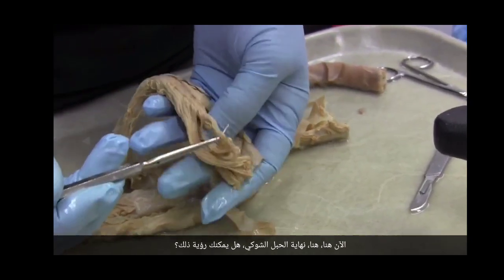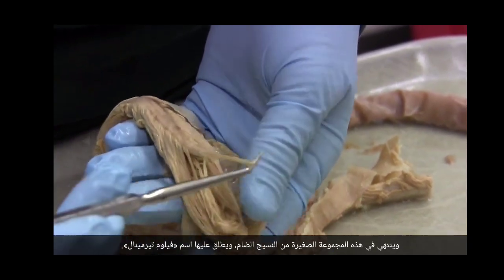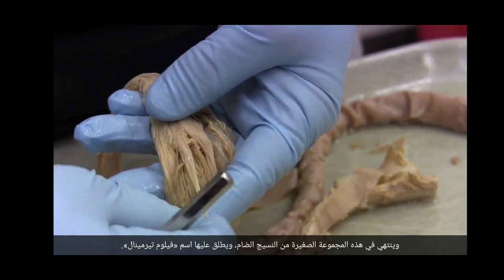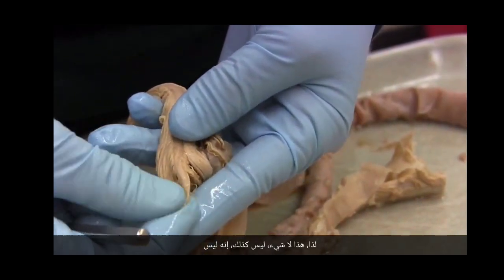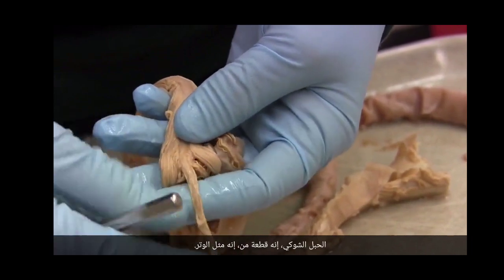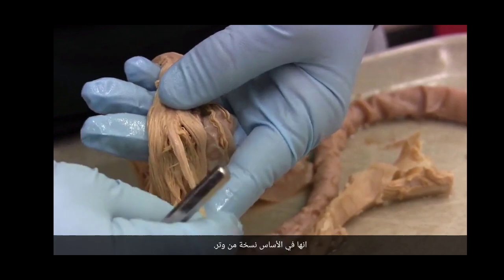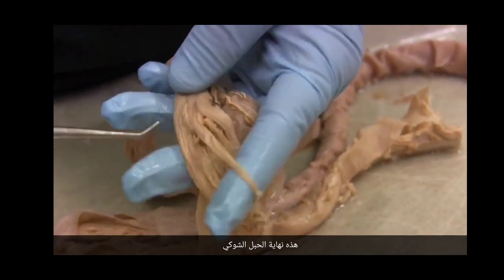Now here, right here, is the end of the spinal cord. Can you see that? That's the end. It ends in this little bunch of connective tissue. It's called the filum terminale. And so this is nothing. It's not spinal cord. It's like a tendon. It's essentially a version of a tendon. And this is spinal cord. That's the end of the spinal cord.